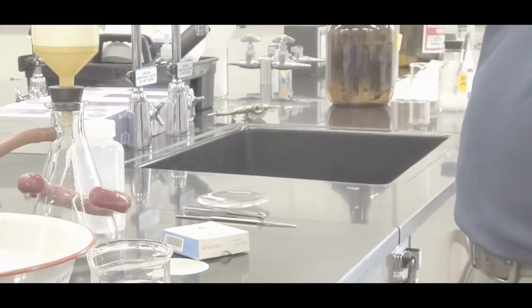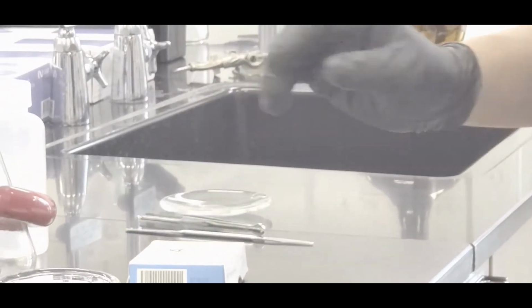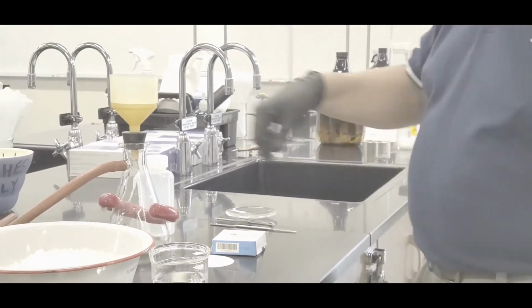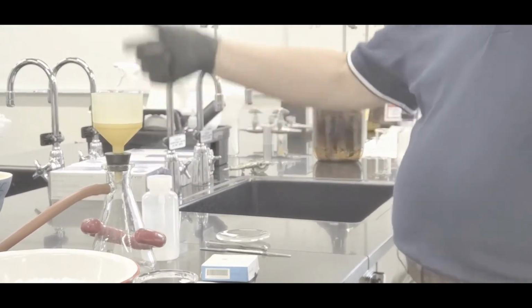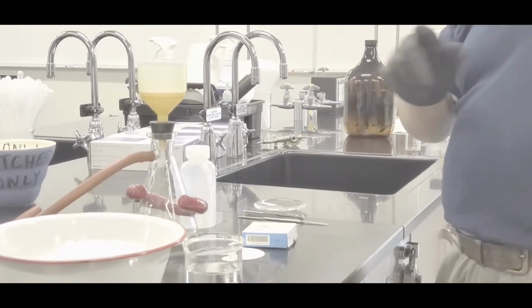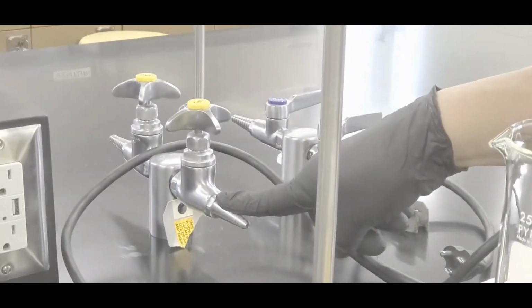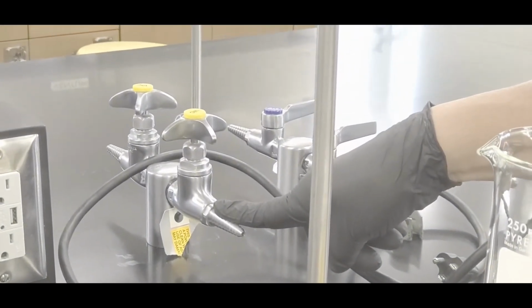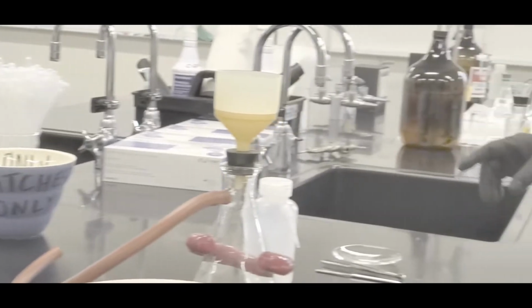Okay, that goes in there. Now you guys, don't waste this. Right now we're running low, so get only one per group. And then you should also have a squirt bottle right here for wetting the filter paper when we get in there. Now, associated with this, we have a vacuum valve right there. That's for making a vacuum so that you can suck the liquid out, and also for drying.